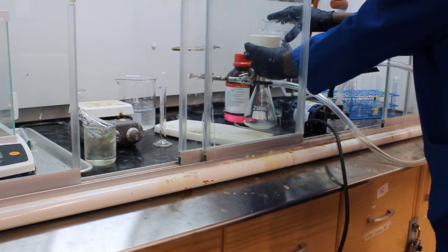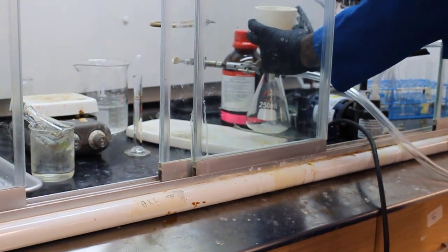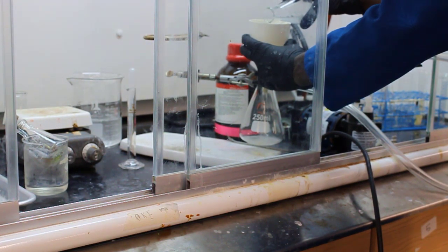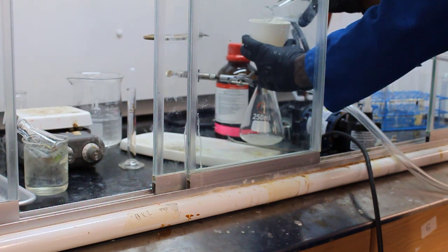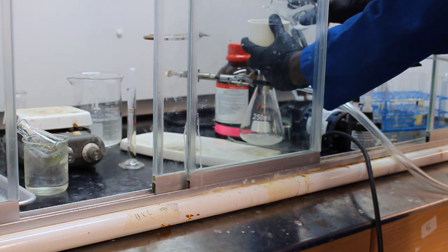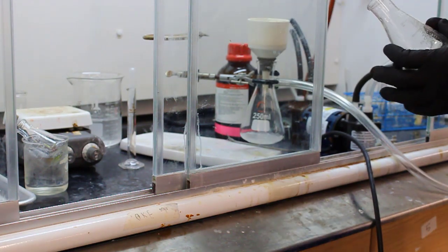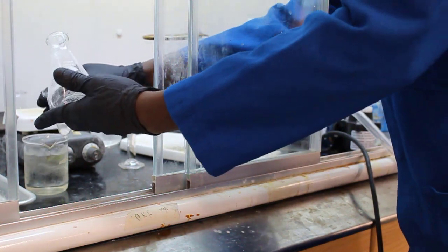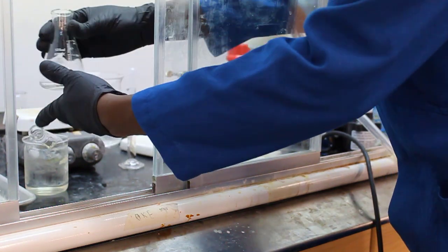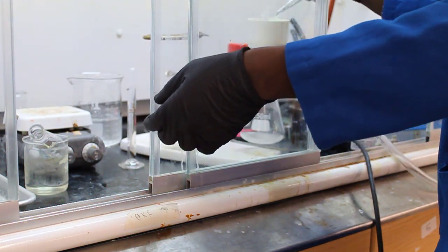The vacuum pump is on and they're filtering. Using that cold ethanol, they try to grab any of the recrystallized product that's stuck.